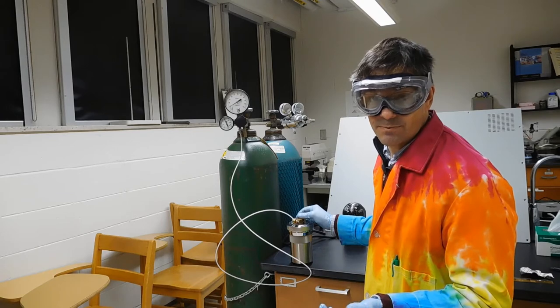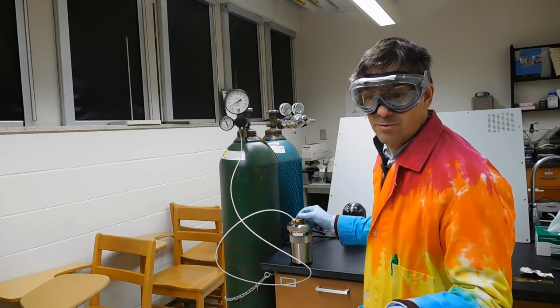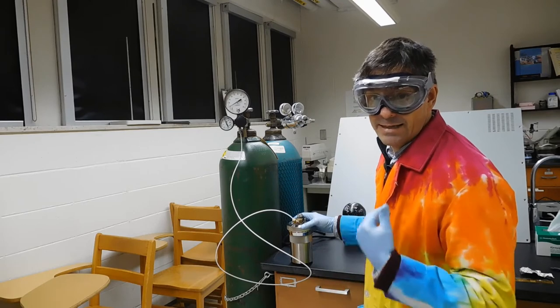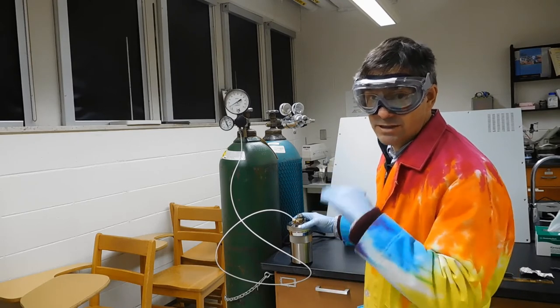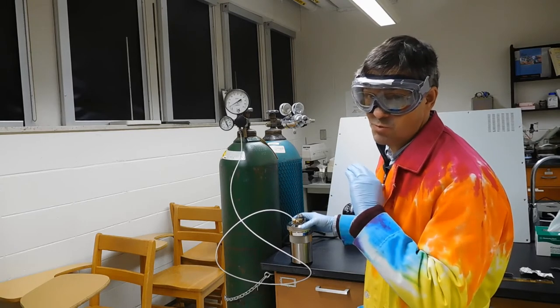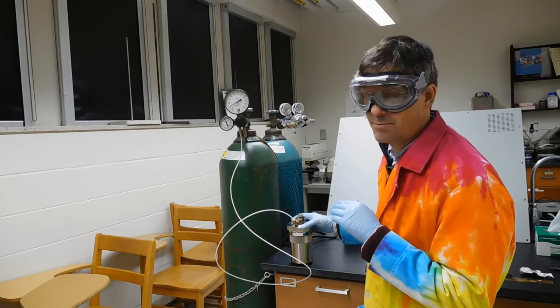I'm watching the clock, and we're purging it to get all the other gases out, and then we'll fill it to high pressure, so we really have a large percentage of oxygen, way over 99% pure oxygen.